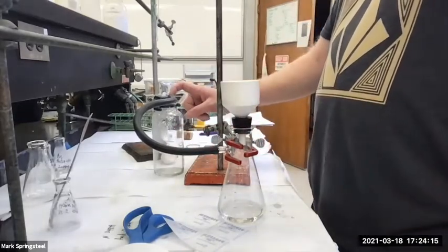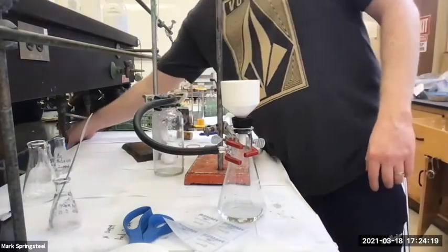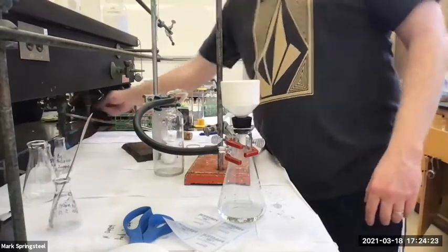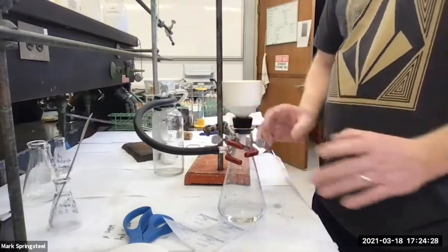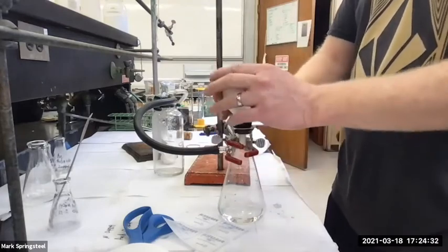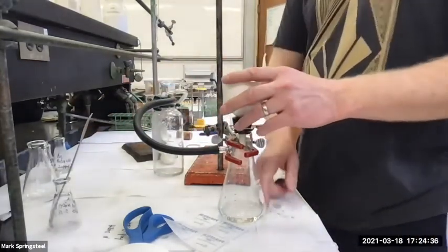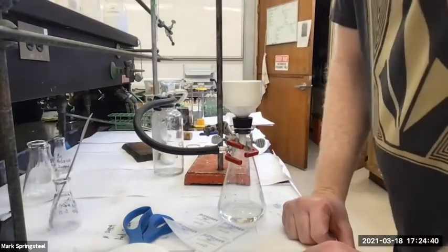Another reason why we do this is sometimes, for whatever reason, the aspirators get old or your splash guard is pushed up too much. It can cause backflow. Let's say I have this set up to suck, and I'm going to wash a couple dishes and let this suck for a couple minutes. During that time, sometimes you can have backflow, and it'll start filling up. So it's a good safety thing, to keep your product safe.